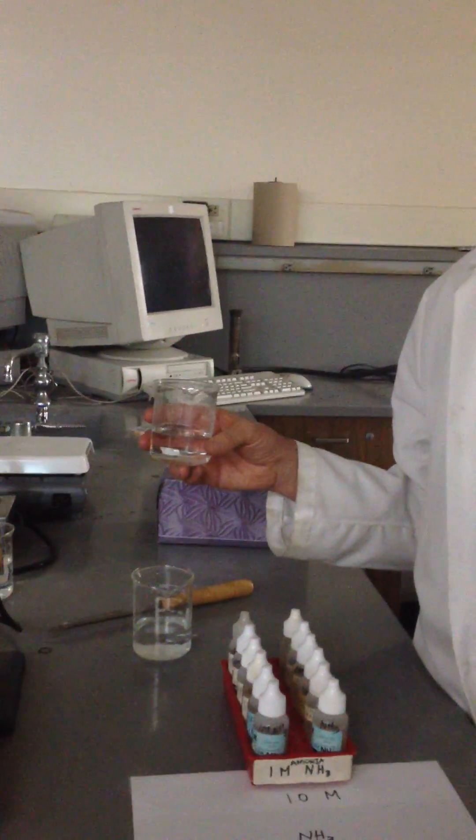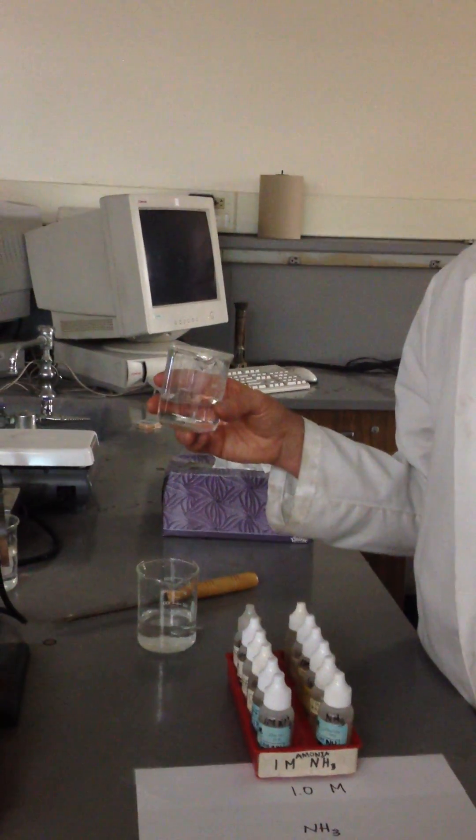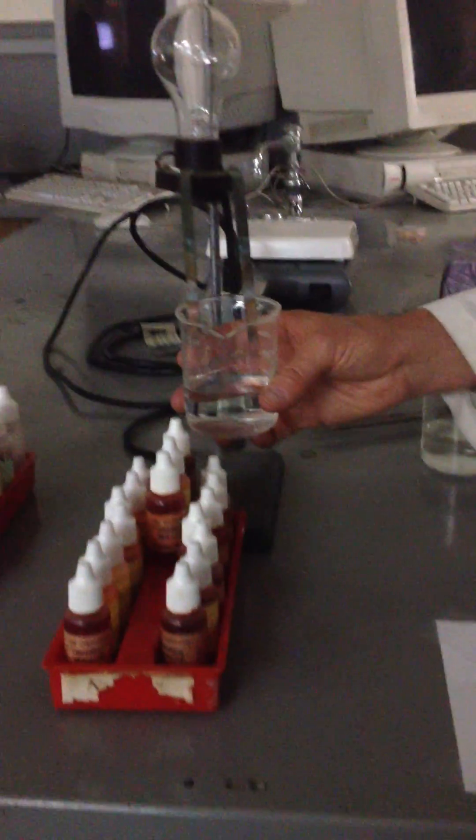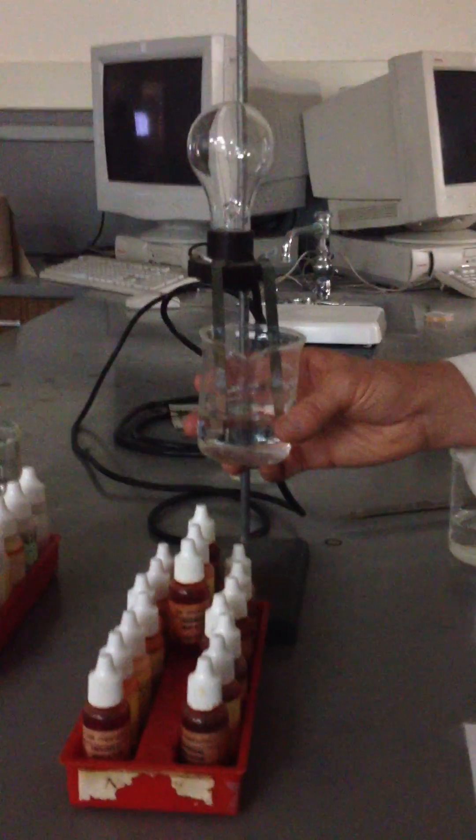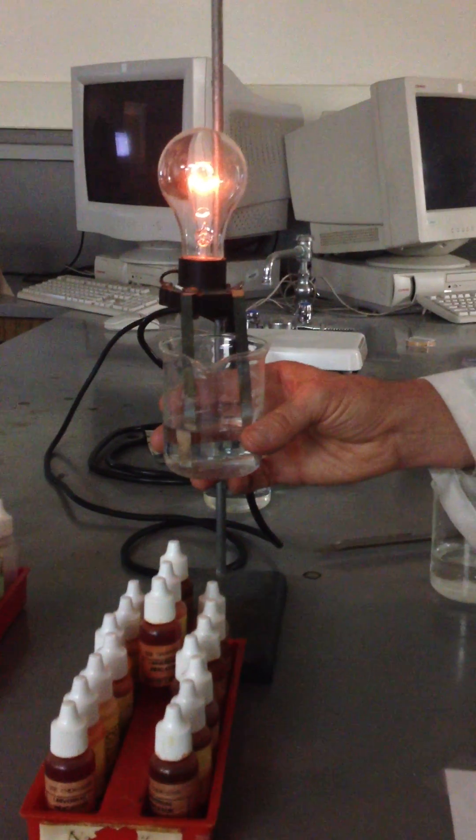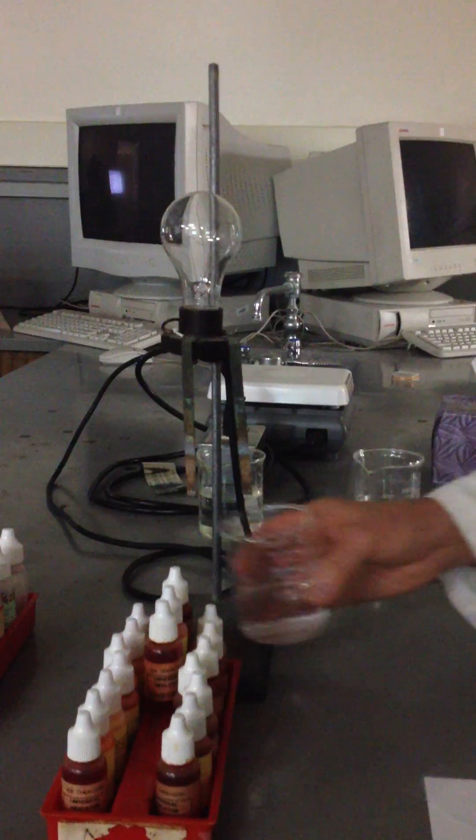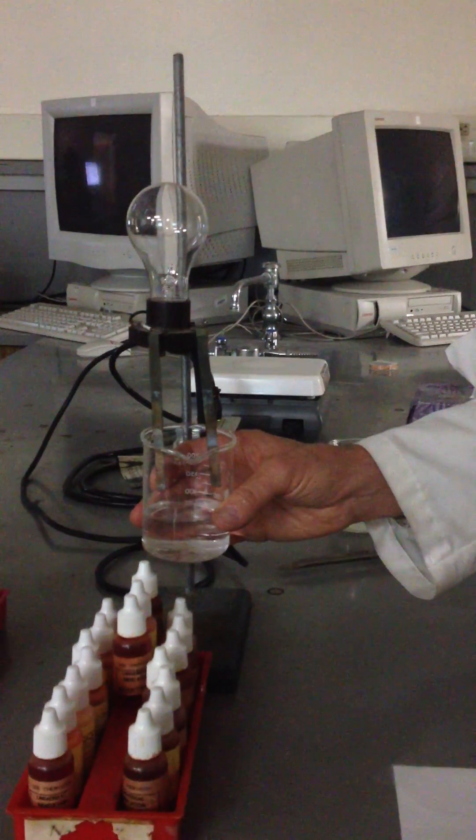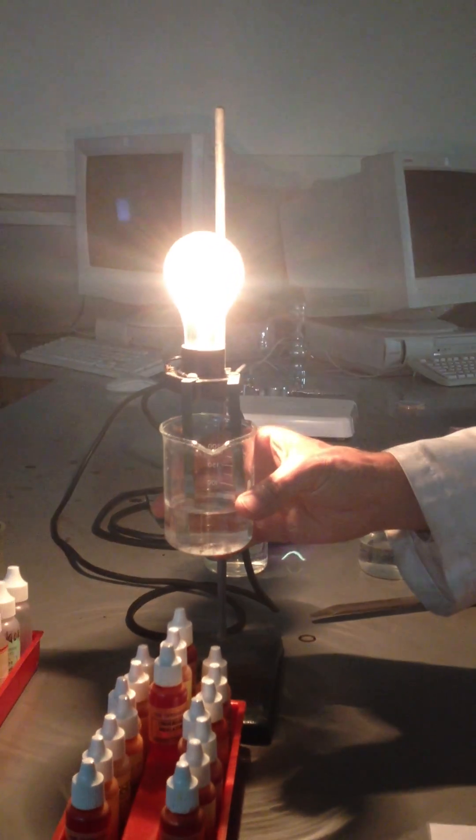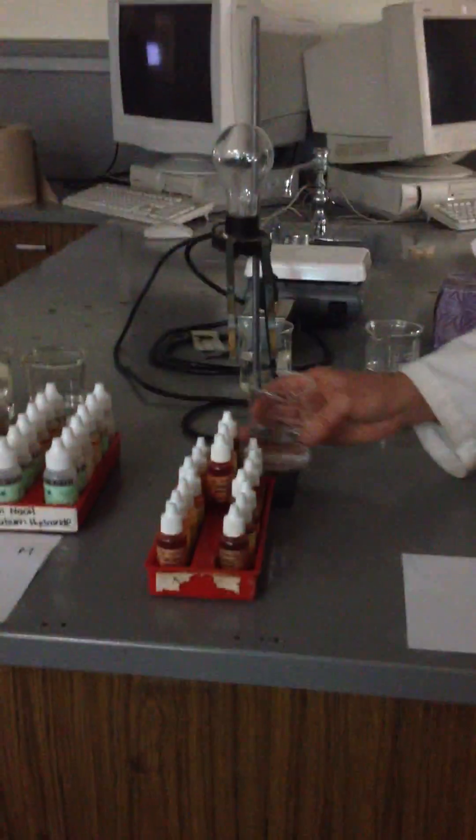Now what's our next thing that I'm supposed to test? Sodium hydroxide. Let's check it out. I'm sorry, I did the wrong one. Okay, sodium hydroxide. What expectation? A lot of light. Yeah, just like the HCl. Very strong base.